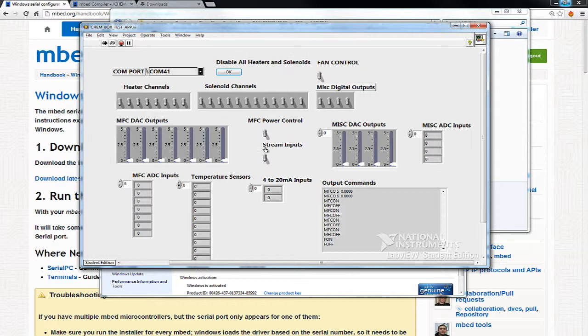Now, the other command that's in there is something called stream inputs. And what this does is periodically sends out the commands to read all the inputs back. So if I do this, you notice here I send out the T command, AIN command, 4 to 20. And what this does is keep sending out commands so I get analog data back. So you can see on the miscellaneous analog ADC inputs, these are just kind of floating around because nothing's connected. I can see my temperature sensor.